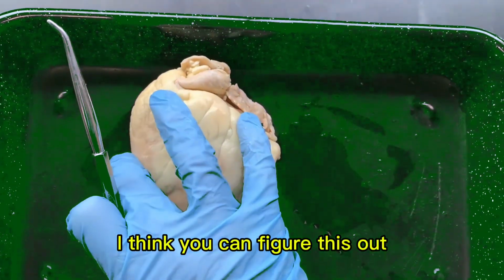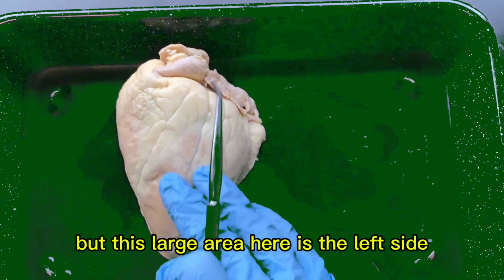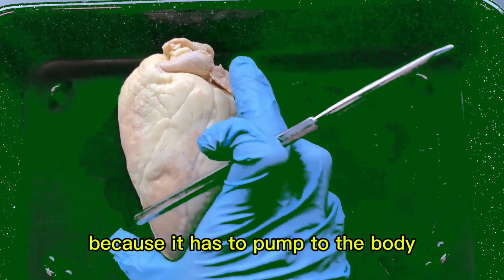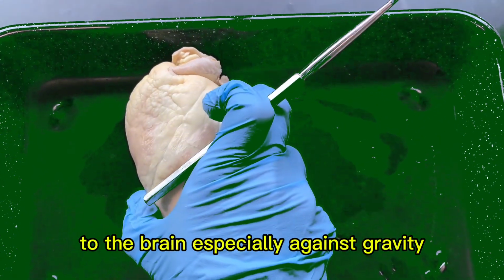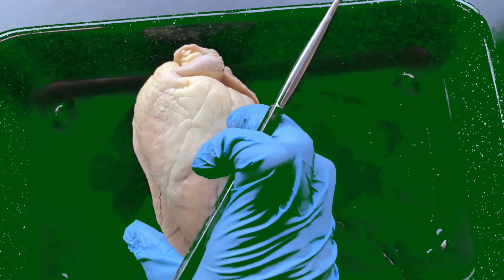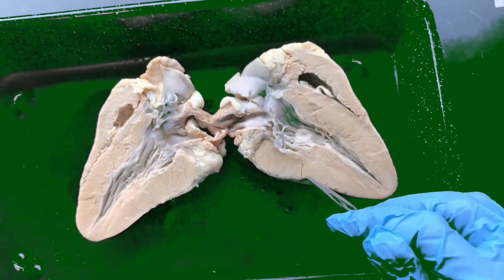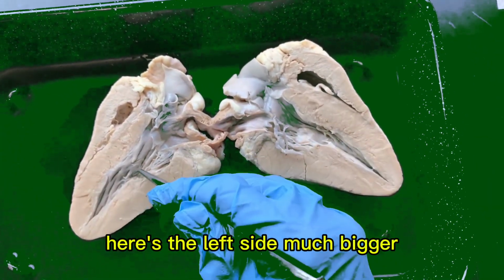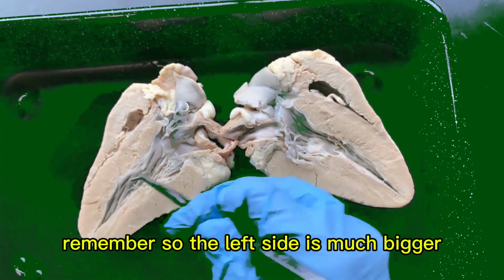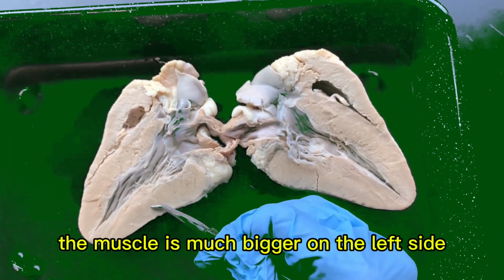I think you can figure this out, but this large area here is the left side. We know the left side is much larger because it has to pump to the body, to the brain, especially against gravity. Keep your eye on this side. Let's open it up. Aha. Here's the left side, much bigger. Remember? So the left side is much bigger. The muscle is much bigger on the left side.